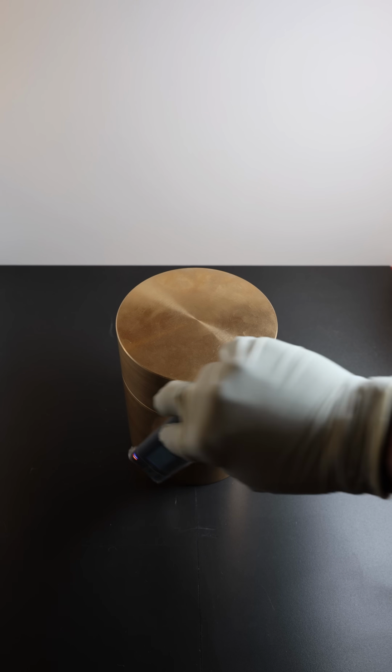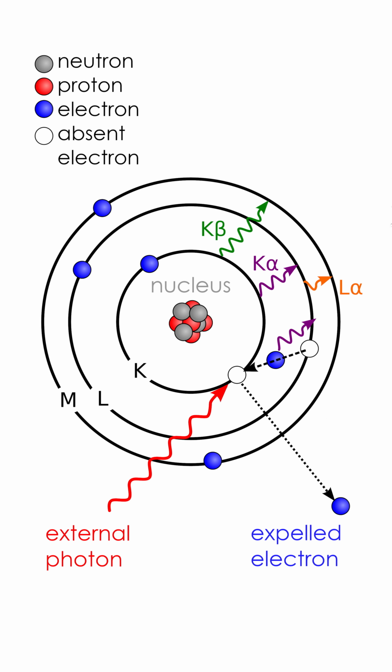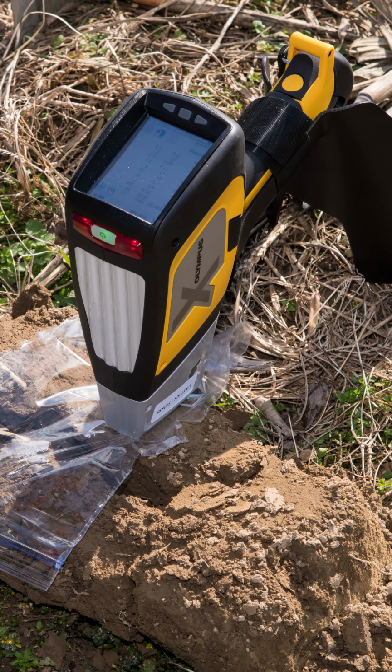On the other hand, there is X-ray fluorescence, XRF for short, where you use an already existing source of photons, for example gamma or X radiation, to ionize an atom, which can lead to electrons being knocked out of inner shells. Now electrons of higher shells fall into the resulting gap, emitting characteristic X-rays in the process. Characteristic means in this case the photon energy varies between different elements and even between different shells of one and the same element. There are many commercial types of XRF devices for material analysis.